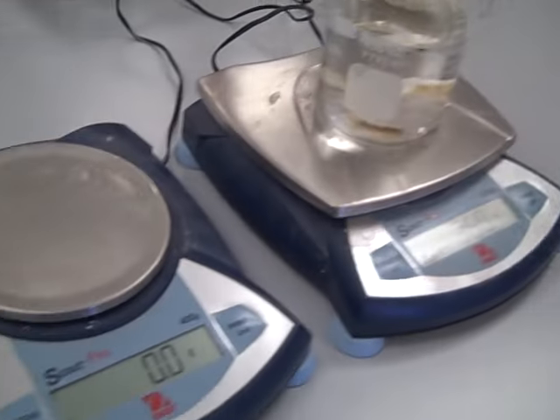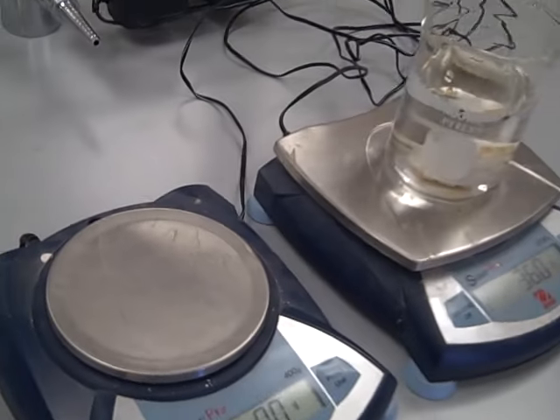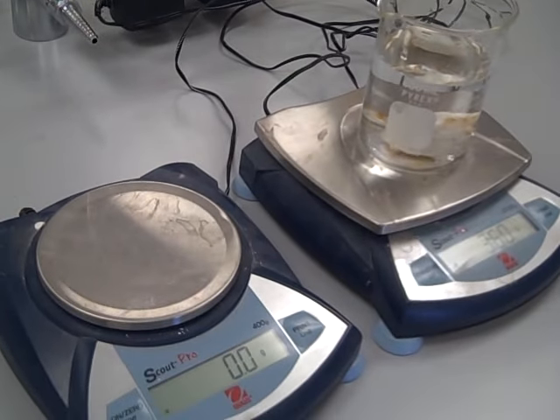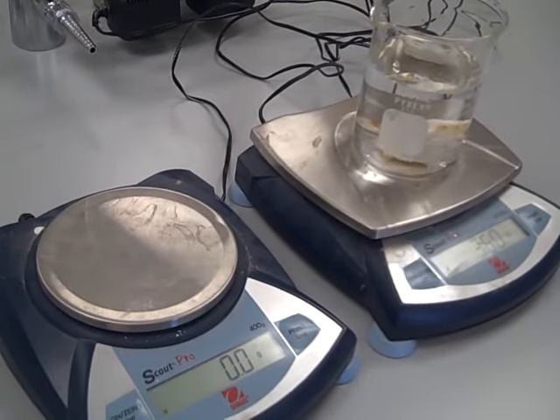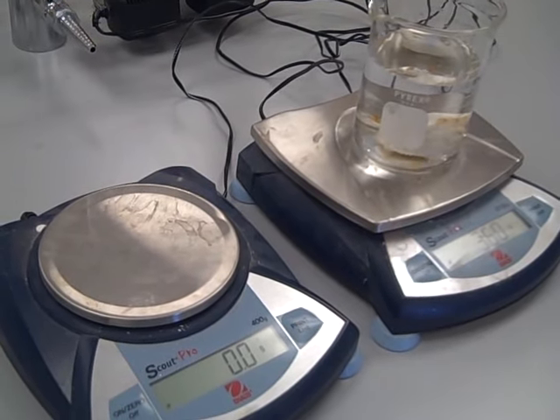So the density of this rock — specific gravity — is 36.2 grams divided by 14.2 cubic centimeters, which is 2.55 grams per cubic centimeter. Very close to the number we use as our average for the particle density of soil particles.